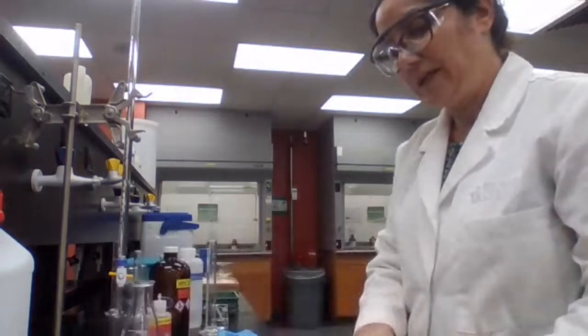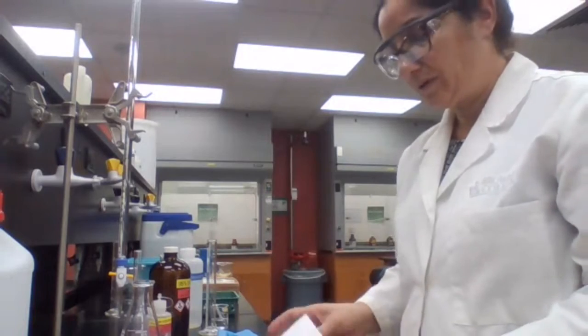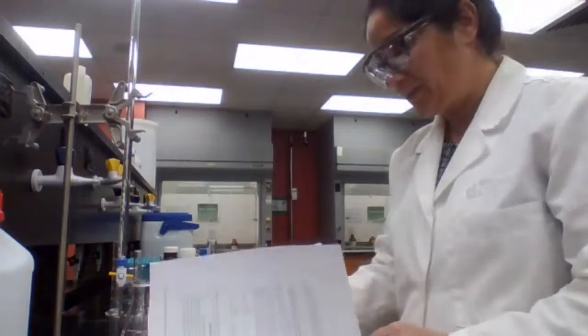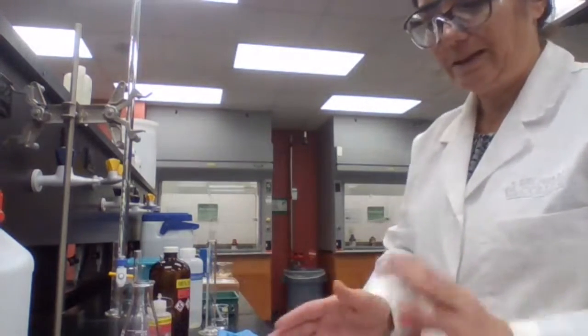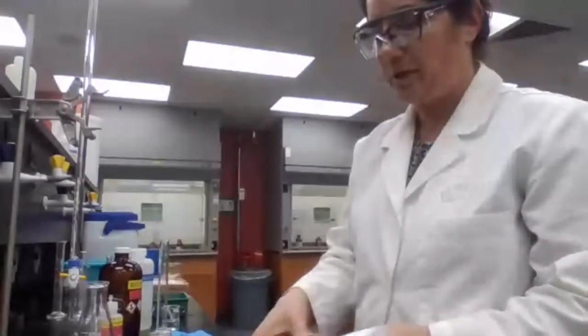when you said that you have either alcohol, aldehyde, or ketone, we need to continue the experiment with your unknown and eliminate the choices one at a time and confirm that you do have the product.